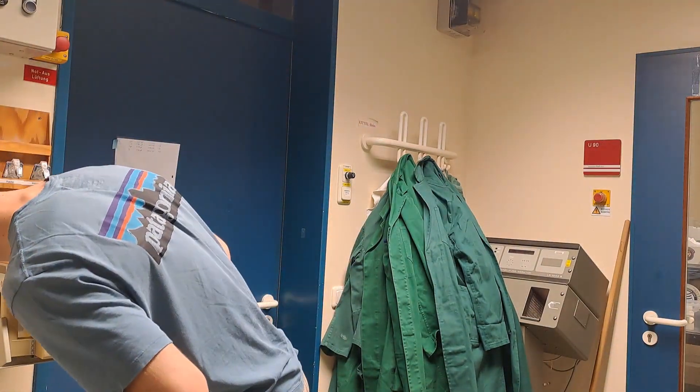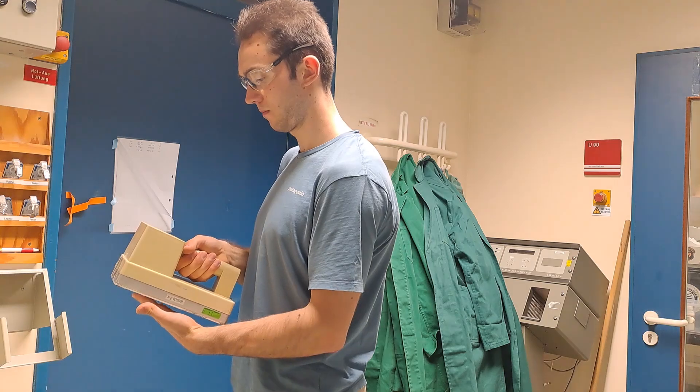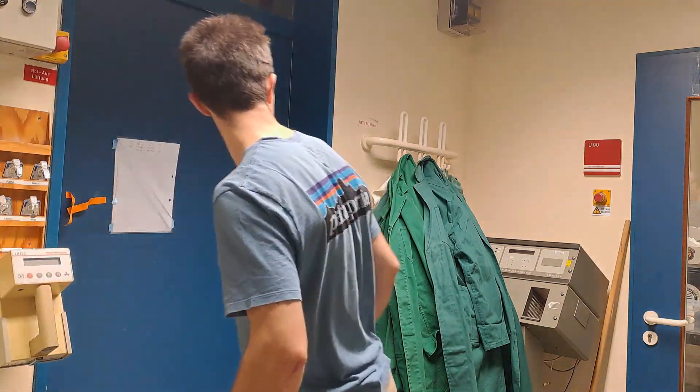Today, I'll be demonstrating the lab experiment preparation of an open radioactive sample. Specifically, we'll be preparing an open sulfur-35 source.